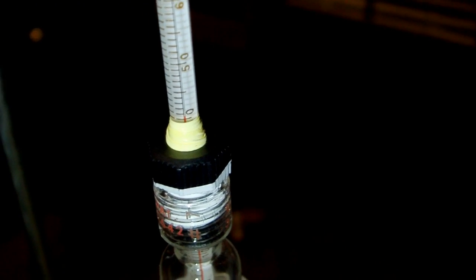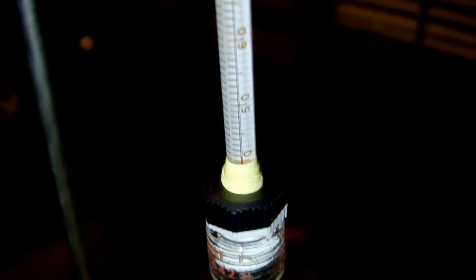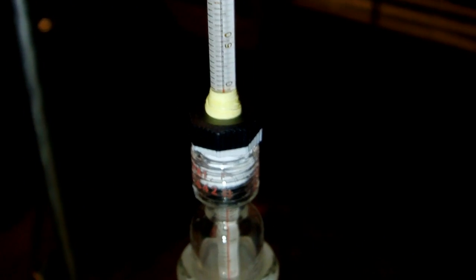And we're still getting a pretty good drip rate over here. And actually, the thermometer is now showing something that makes sense, which may be hard to see, but it's just poking up at the 40 degree level there, which is where it should be. So throughout this whole distillation it should stay at that level. And then once it begins to rise up towards 60, that's when I'll stop.